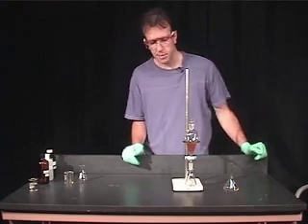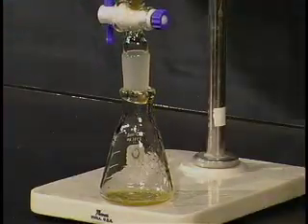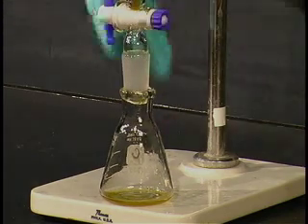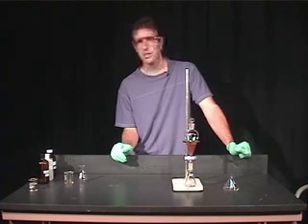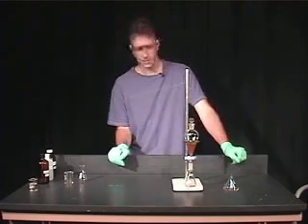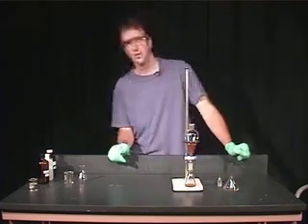One of the most common issues is if you leave the stopper in and then decide to open the stopcock to remove the lower layer. As you can see, I open the stopcock — it's completely open — and just a little bit of solvent has gone through and it's stopped. Nothing else is going on. This causes students tremendous frustration because they can't figure out why the solvent is not moving. That's simply because you haven't removed the stopper. Once I remove the stopper, the solvent starts to move.